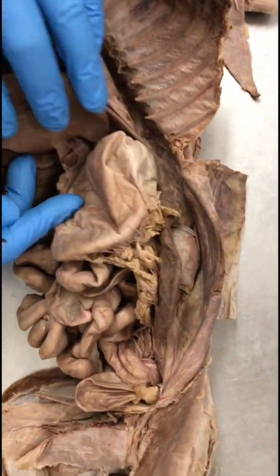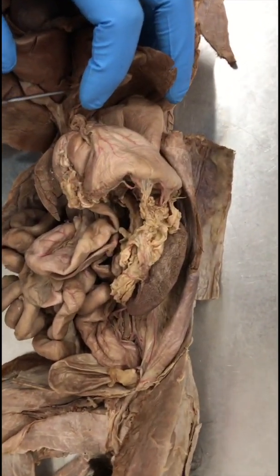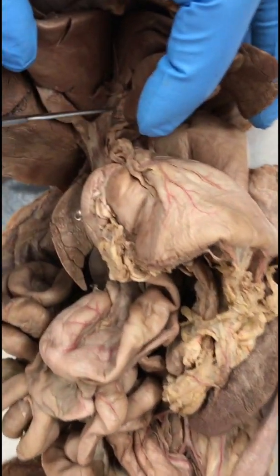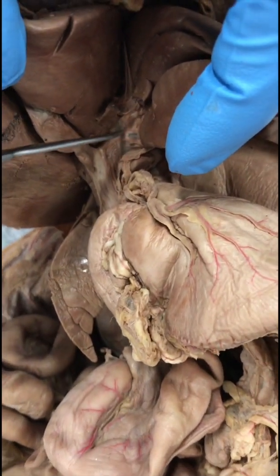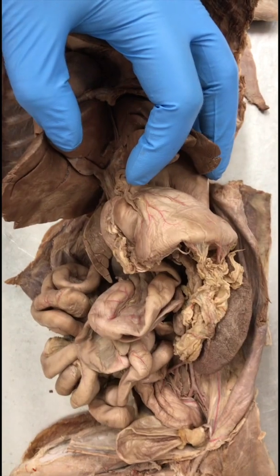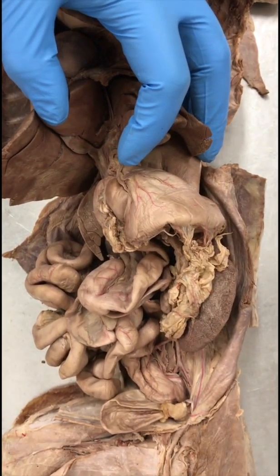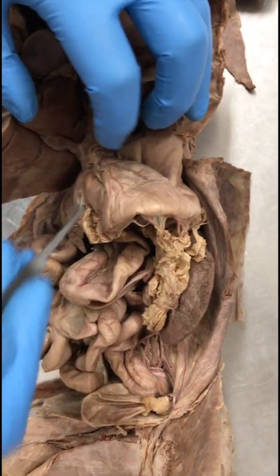We are usually able to see only one of them. So here, this is one hepatic duct. Okay. This is one hepatic duct. So always look for the question. Is the question a duct or a vein or a blood vessel or a ligament or something? Okay. So always look at the question for this region.